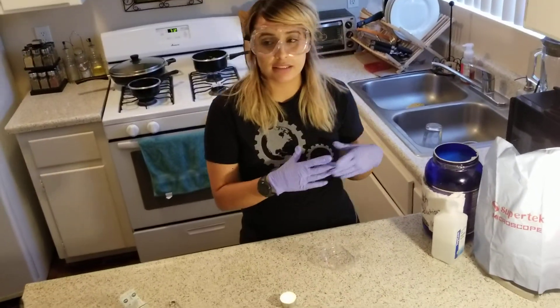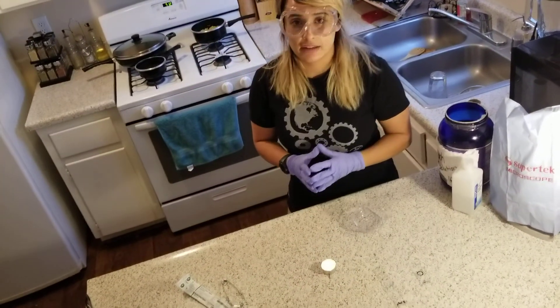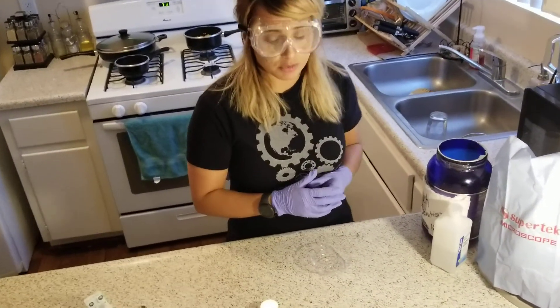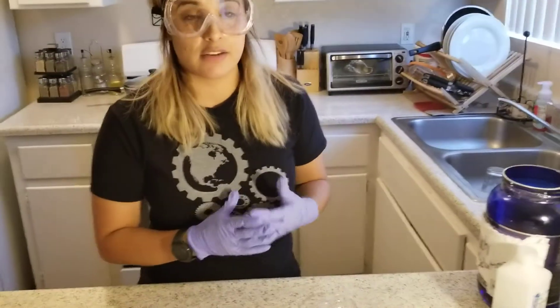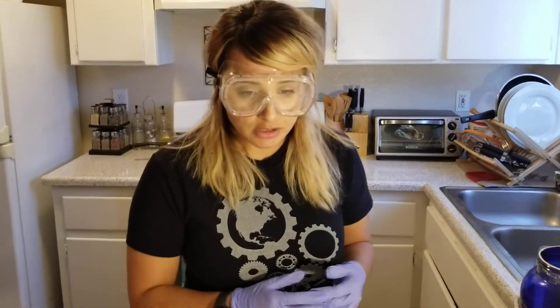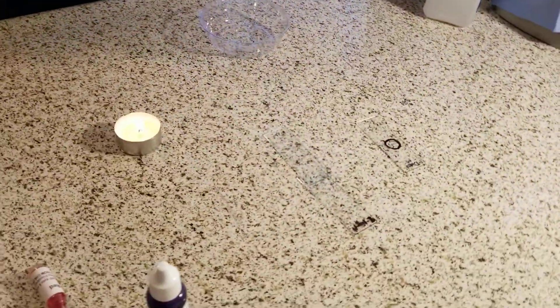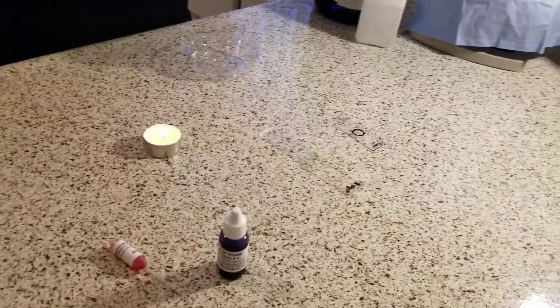This exercise is going to be the first of direct and negative stains. I will be using simple stain techniques with direct and negative stains to prepare smears. I will identify basic morphology, including bacterial shapes and arrangement.